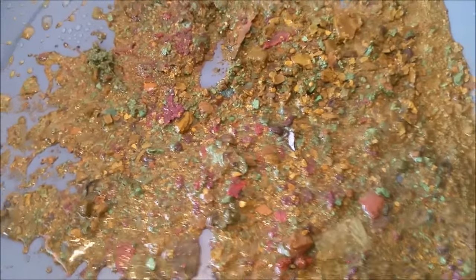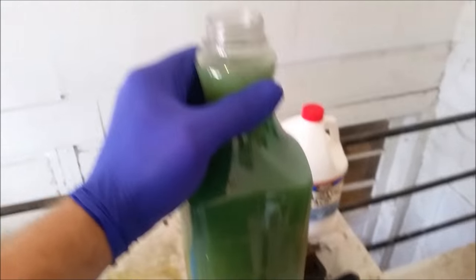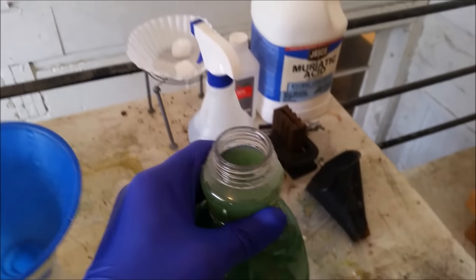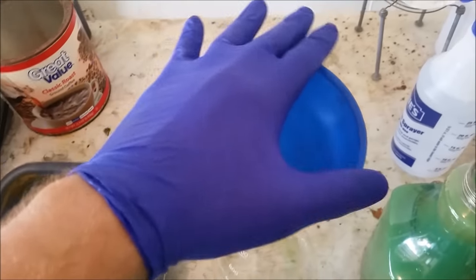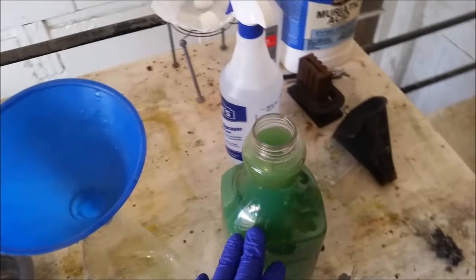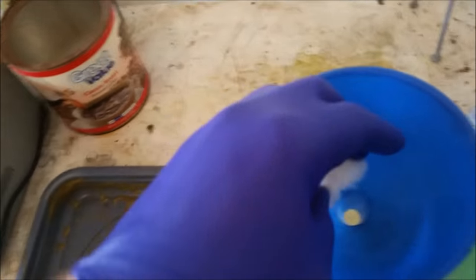I managed to decant this off as best I can. It's got a lot of different colors but looks to be primarily copper. This is the biggest clear container I could find. It's starting to settle out but it's a long way from being that nice crystal clear light blue that copper sulfate is known for. So I'm going to filter it off using a coffee filter. Anyone who has tried to filter anything with such a small precipitate knows a coffee filter just isn't going to cut it — so a little trick is to use a couple of cotton balls in your filter.